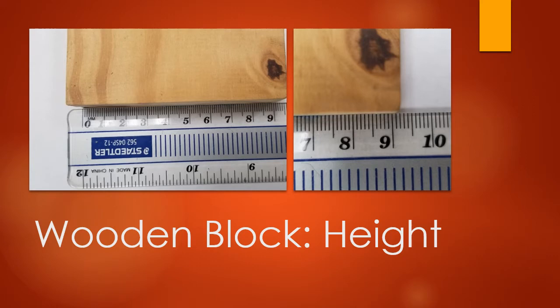Next, we're going to measure the height. And this time I'm going to leave it to you to decide what exact measurement you want to write. In the picture to the left, I show you the total height of the block, going from 0 up to the 9 centimeter mark, and then I have a close-up in the picture to the right. So you can decide for yourself. We're using the same ruler, so it goes to the 10th spot, meaning you're going to want to write out to the 100th spot when you write the height of that block. You can pause the video if you need more time to look closely.